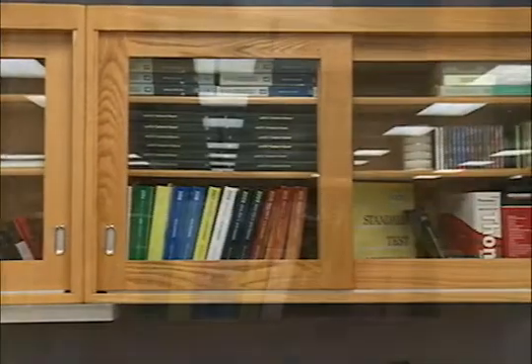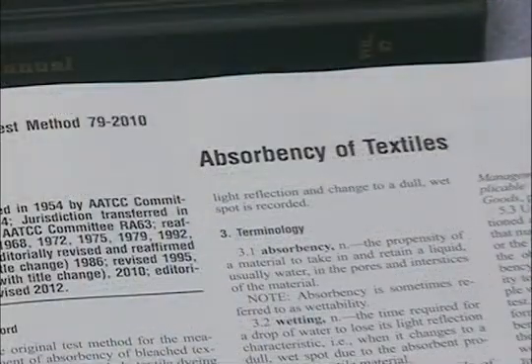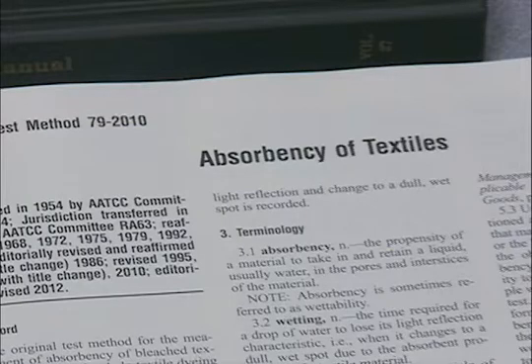A preliminary step for this test method is to determine whether the fabric is absorbent by using AATCC Test Method 79, Absorbency of Textiles.